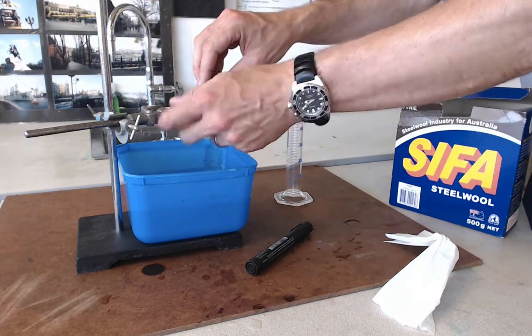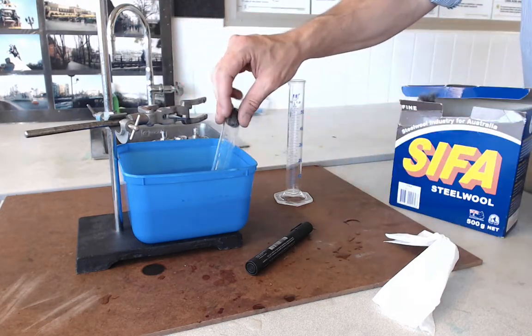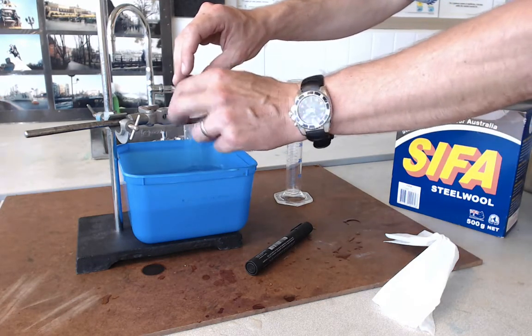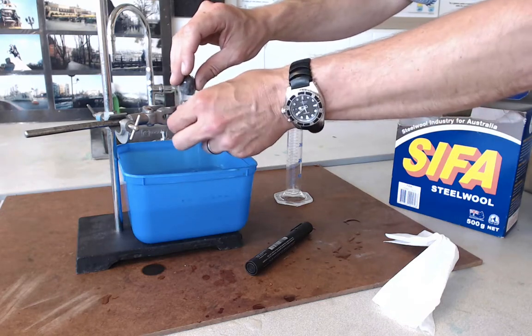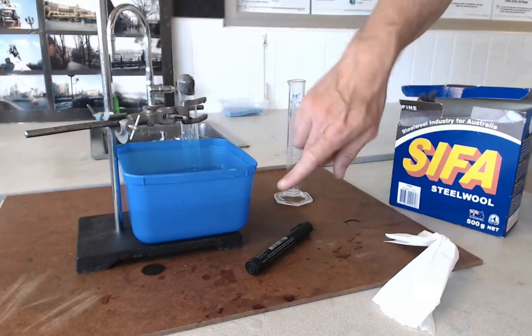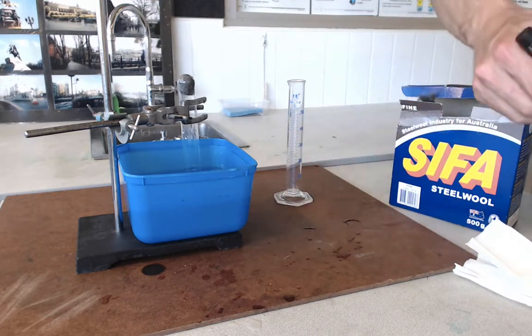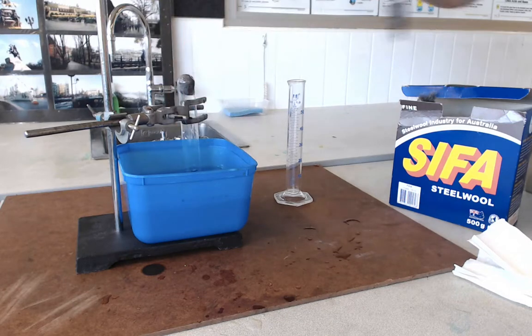I'm just going to put a little bit of water back in there — I don't need much. When I raise the tube, remembering to keep the mouth of the tube submerged, the level of the water inside the tube should be a bit higher than the liquid level outside. That's going to enable me to dry the side of the tube — it's much easier to mark then. I'm going to take this texter and just mark the level of the water inside the tube like so.